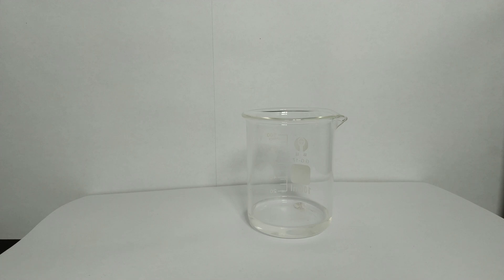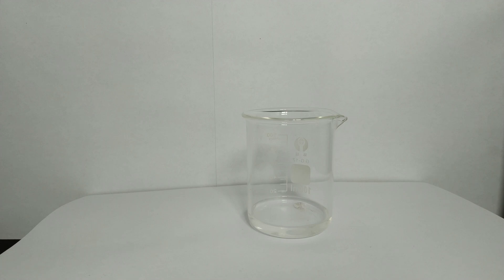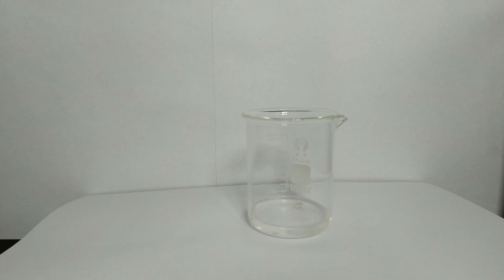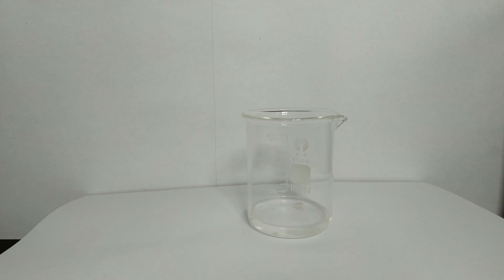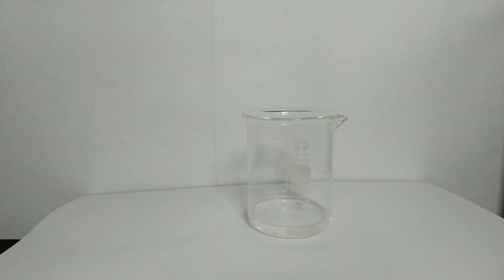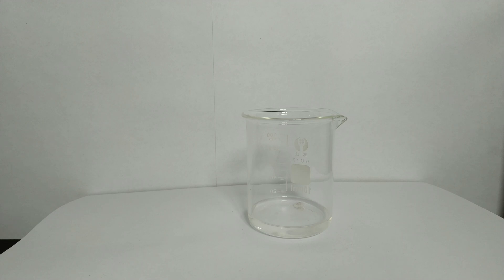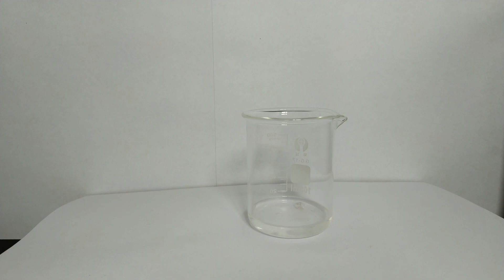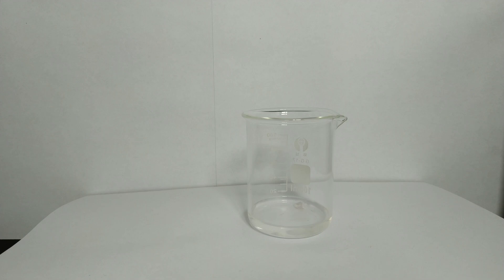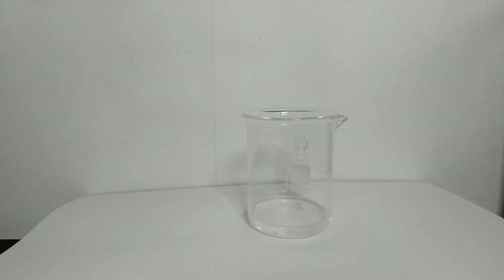As we can see, the reaction proceeds quite slowly but faster than between sodium and isopropanol. Also the outside layer, made up of oxides, quickly disappears. Alkoxides are strong bases and hygroscopic, which means that they will pull water and react to the corresponding metal hydroxide and the alcohol, whereas even the humidity of the air is sufficient. In this instance it would form sodium hydroxide and ethanol.